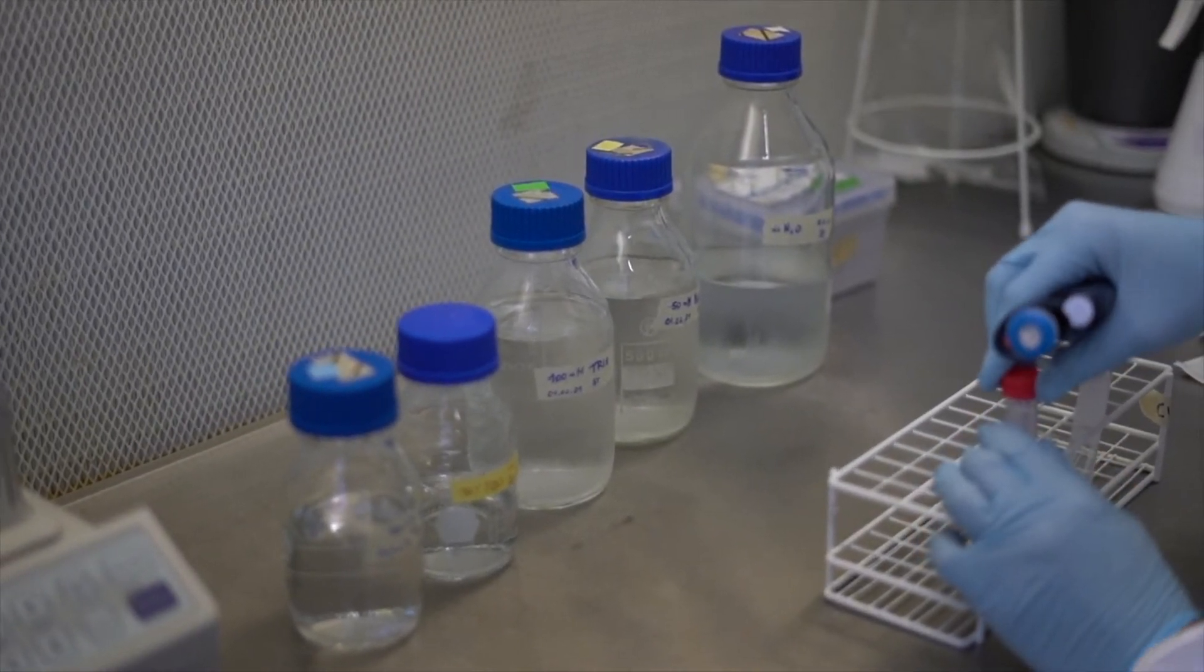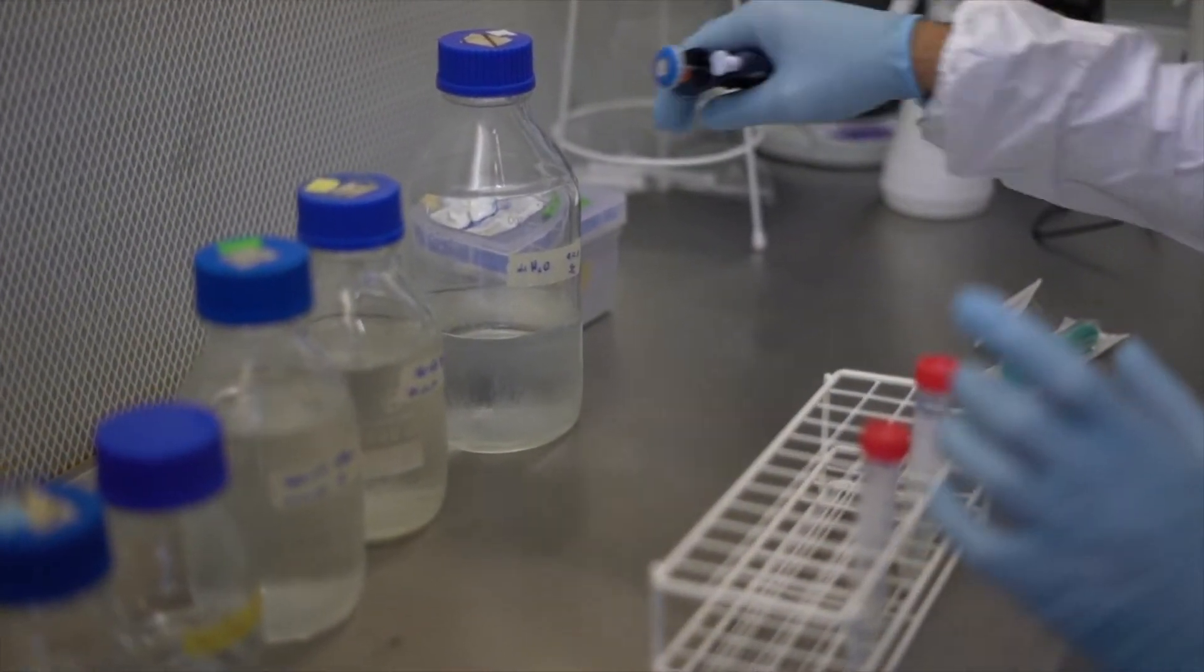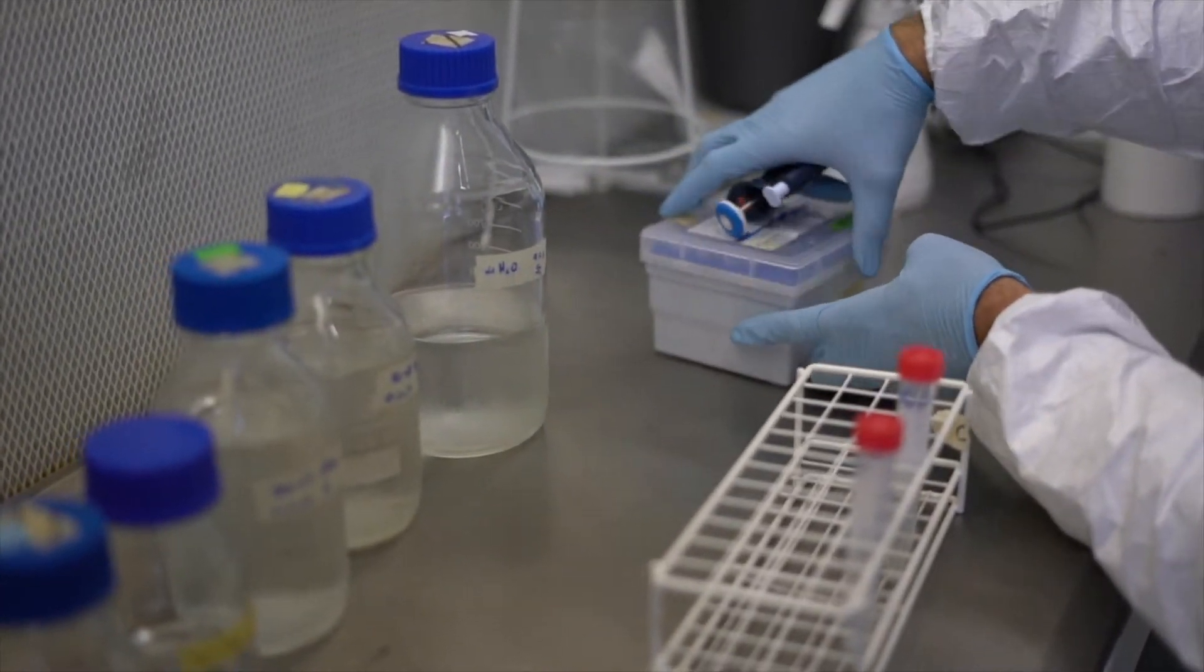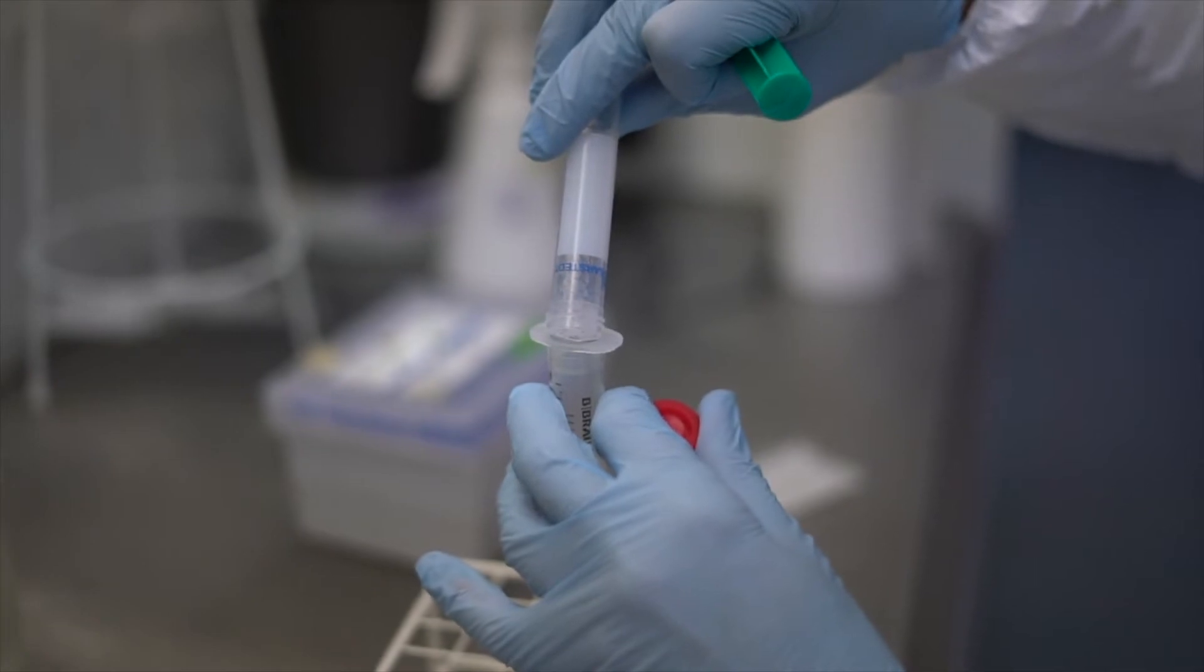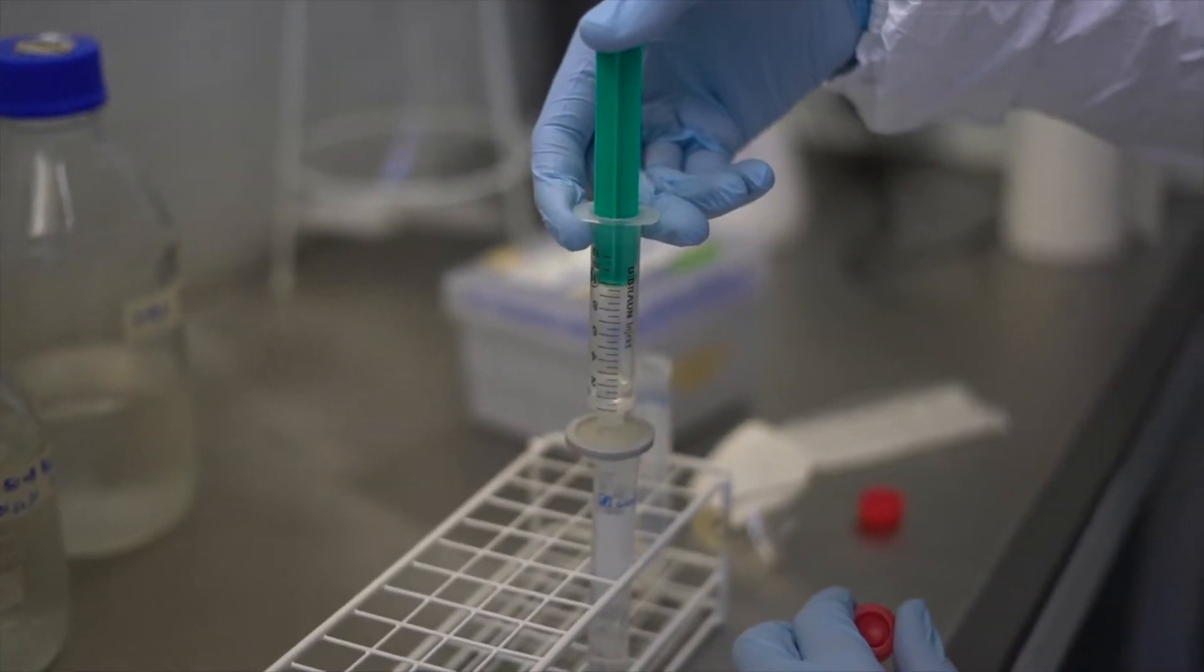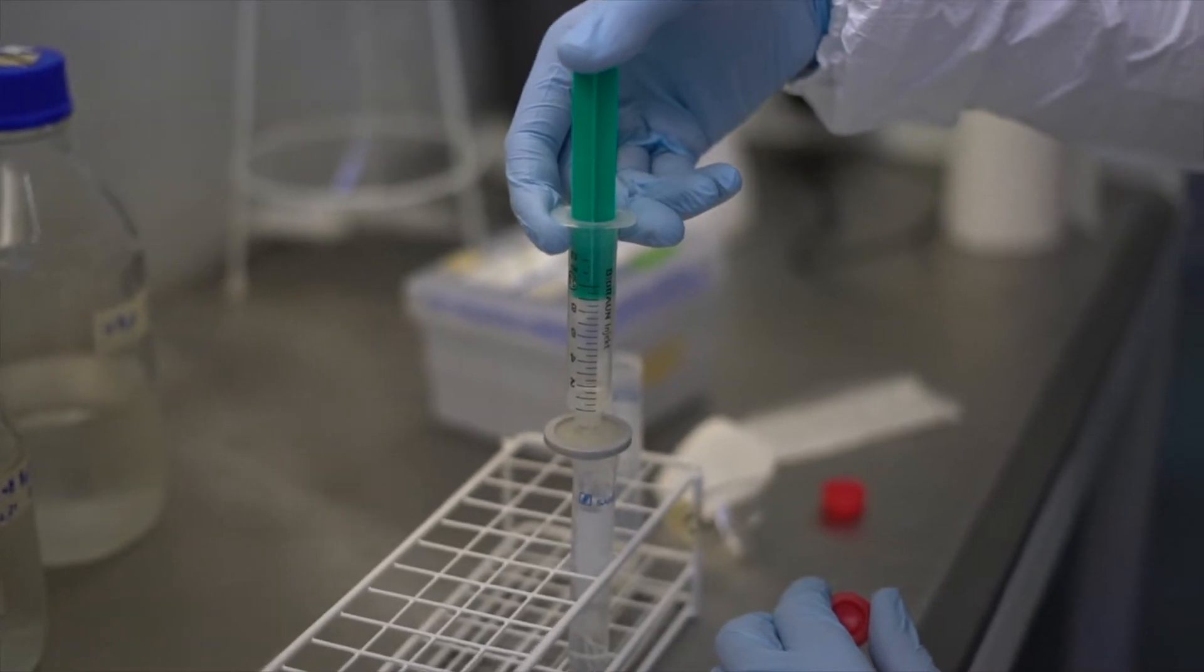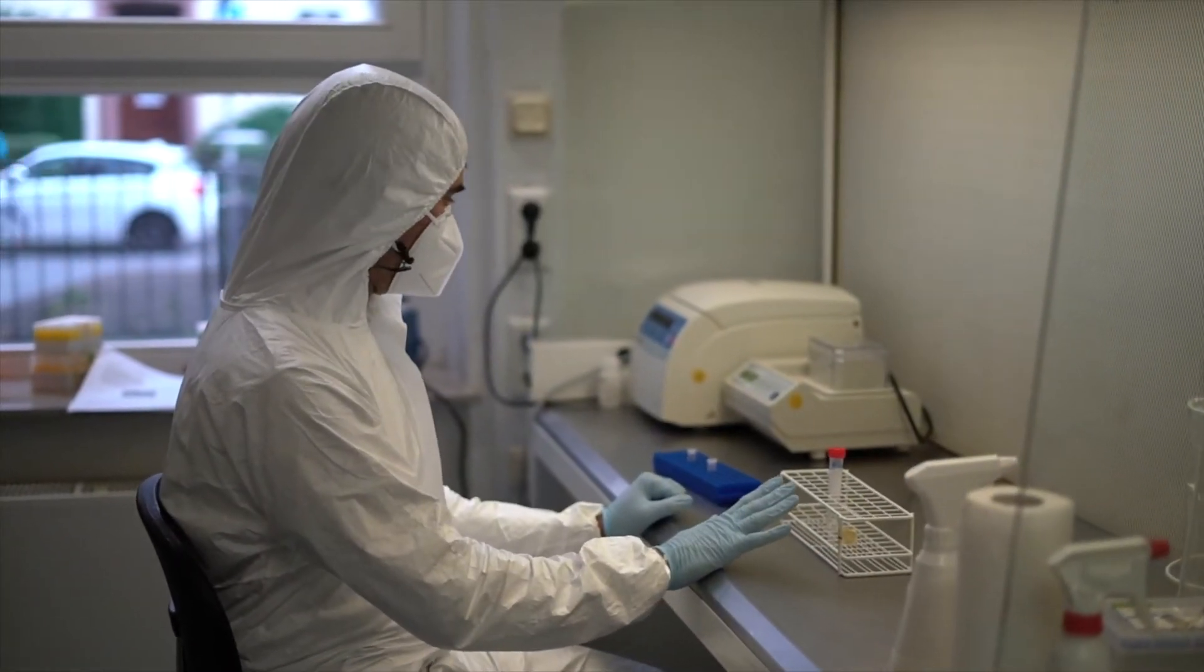Now I have everything inside each compound inside the buffer. I will just add water to adjust the concentration. I will filter it with a syringe and filter just to be sure that everything is still clean. Good, now the buffer is prepared, the lysis buffer is prepared.